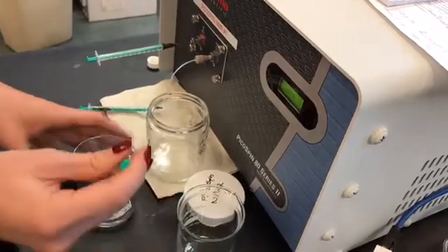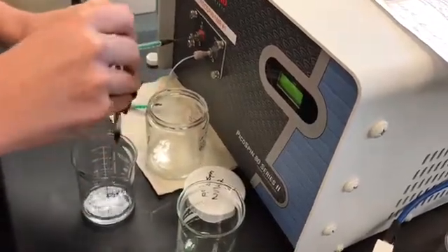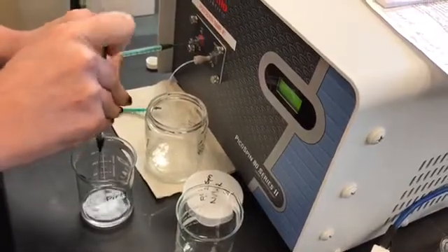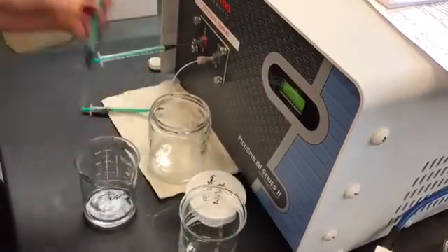And then you want to pump the plunger ten times to remove any traces of acetone.